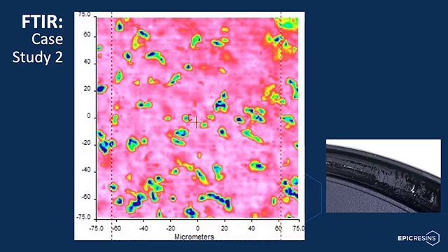In looking back at the FTIR array, the dots that are blue in the array are areas where the B side was not sufficiently mixed, and the pink regions are areas where sufficient mix was achieved. Upon sharing these results with the customer, they investigated their meter mix and dispense equipment and found that they had a partially plugged dispense head manifold, which was causing a lead-lag condition during the dispensing shot. After completing necessary maintenance protocol to their equipment, we were able to re-verify their mixing process was correct.